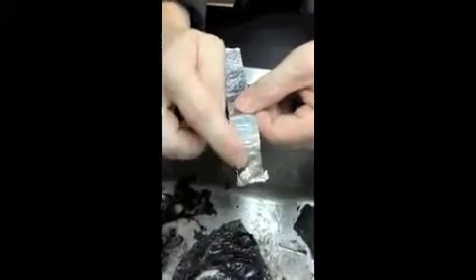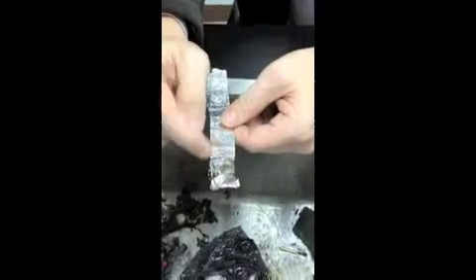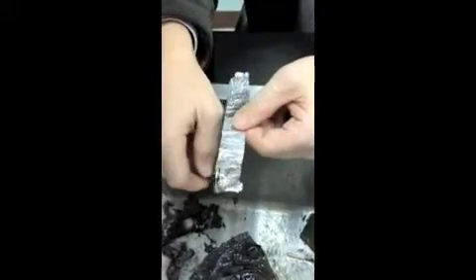The black soot on the aluminum can be inferred to be from the wood burning, not the aluminum burning. Because when you brush it off, it actually just comes off, and the aluminum is still the same color and the same type of metal it originally was.